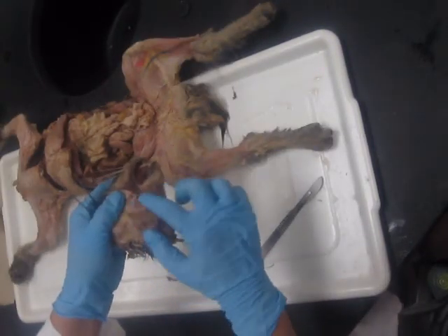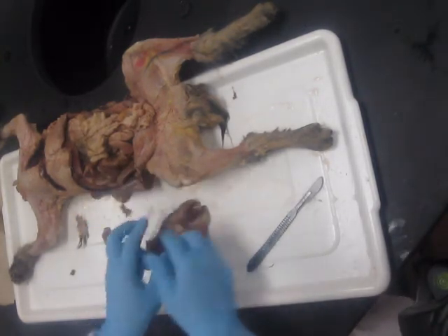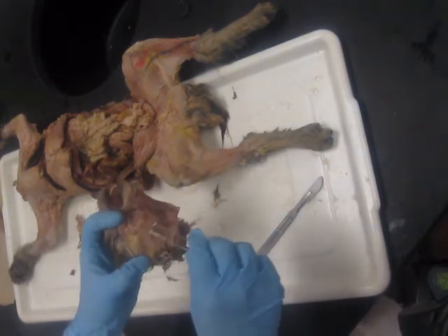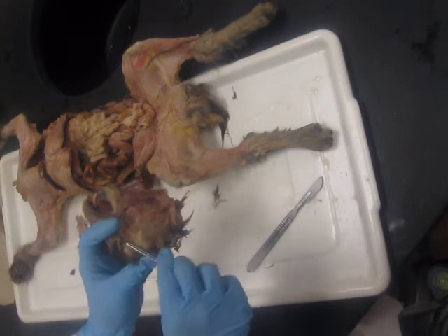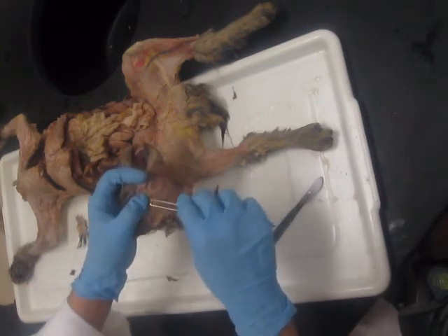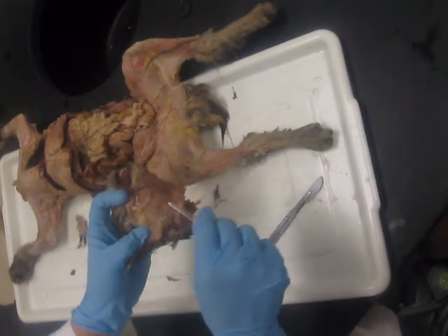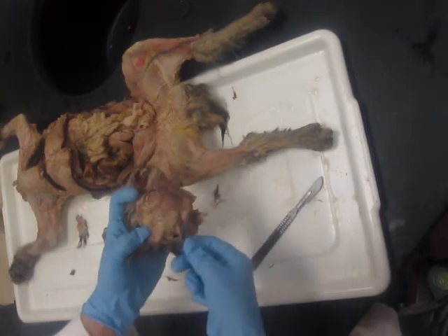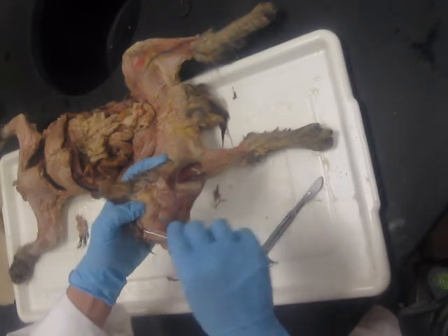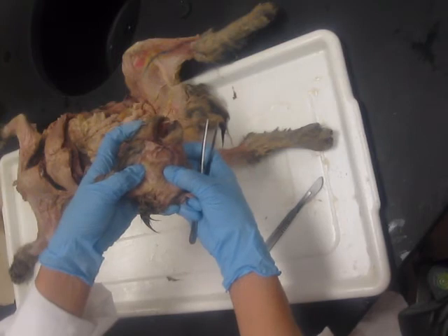Epimysium came with it, but this roundish kind of ball of muscle on the side is the masseter. Okay. Now the tissue over the gland, you don't usually want to use a scalpel. You want to just try to grab it with your forceps and kind of peel it from the parotid gland. Because if you use the scalpel and you go too deep, you'll peel this gland right off. Okay, so you can see how I'm just gently removing this superficial layer. And there's our nice parotid gland there.